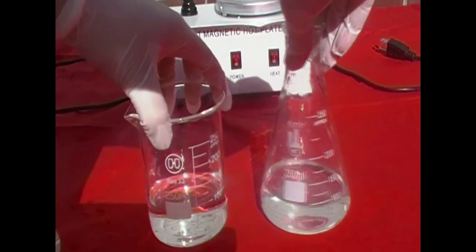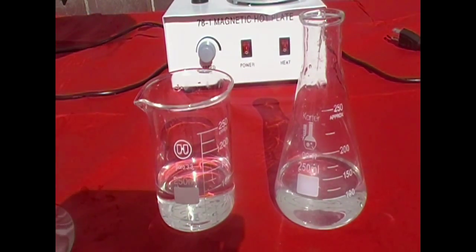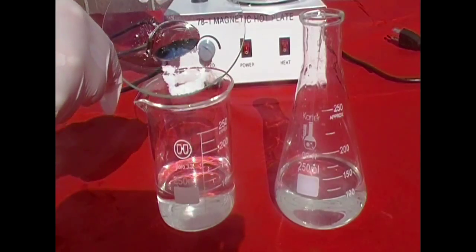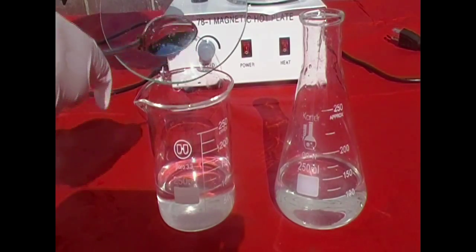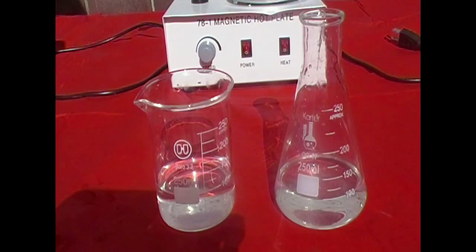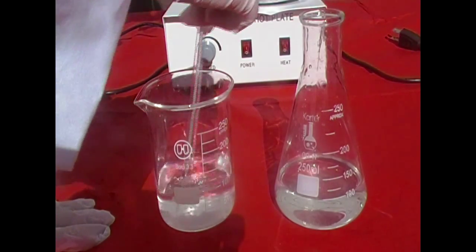I originally used 2 grams of each, but however, like how I always do these things, I always put in way too much. So this later on caused a problem with the later demonstration I wanted to show. So yeah, like I said, there was too much precipitate to fully dissolve into the solvent. So this solution became saturated. Basically, I'll be explaining this a little bit later in detailed form.